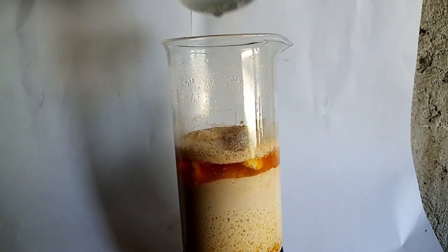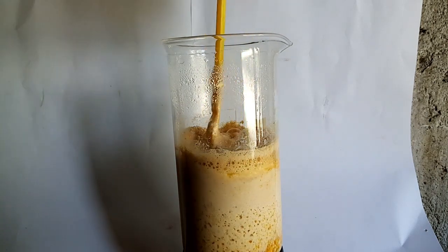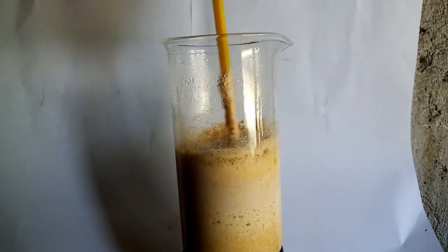The next day the mixture looked like iced coffee and I think most of the reaction is done. But to be sure I stir it for a bit and let it sit for another 2 hours.